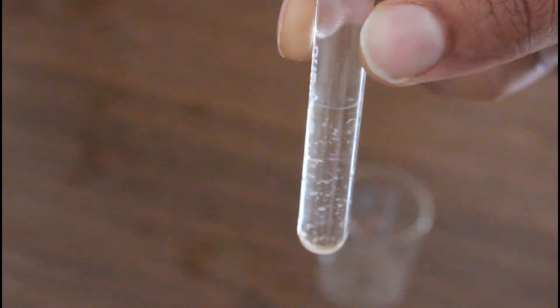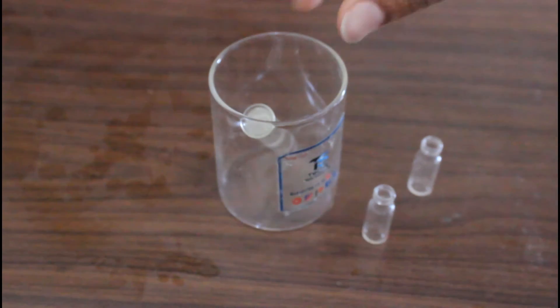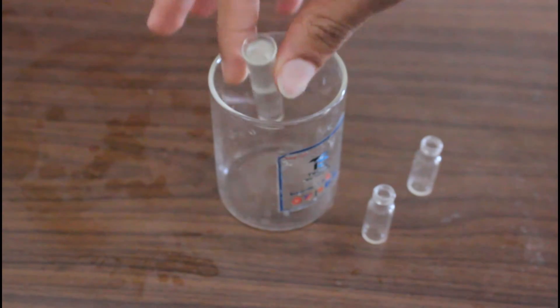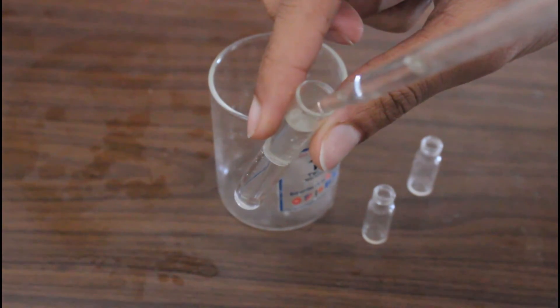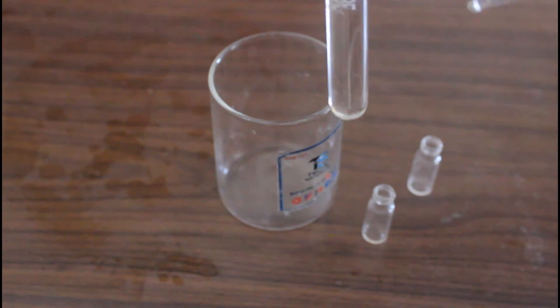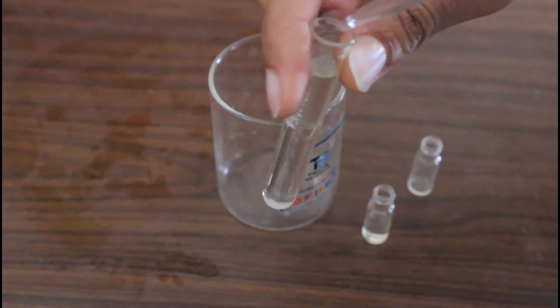And also it contains some white precipitates. Let us keep it still to settle down this precipitates. Okay, now as you can see we got a clear liquid. Let us collect it.